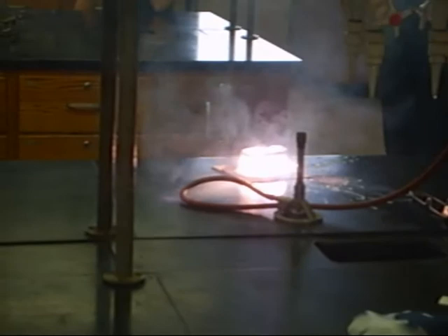Is that how they make charcoal? I'm not sure how it works. I'm just telling you, that's a little bit more reactive than just the magnesium itself, wouldn't you say?